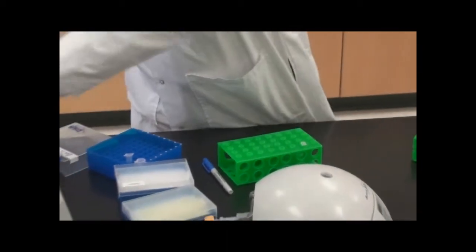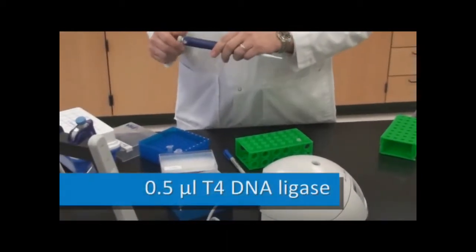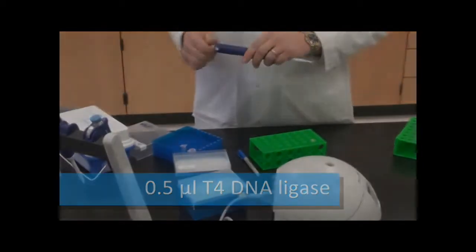And for the last part, I need just half a microliter, so very small.